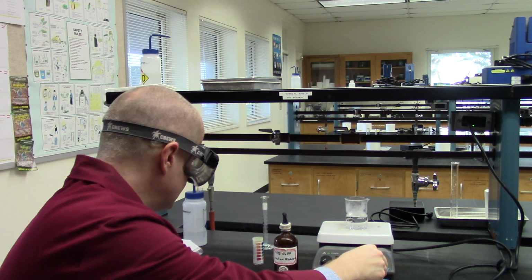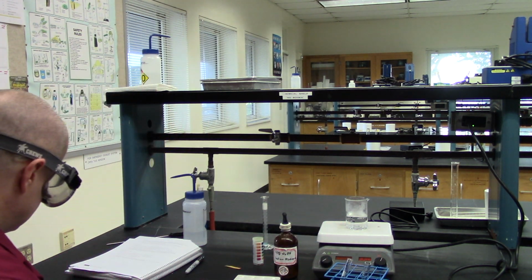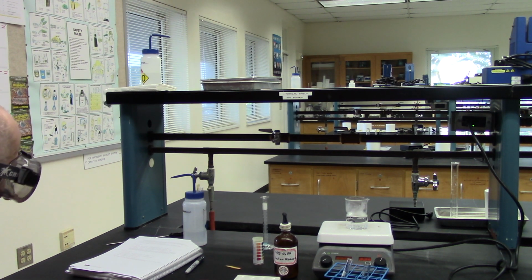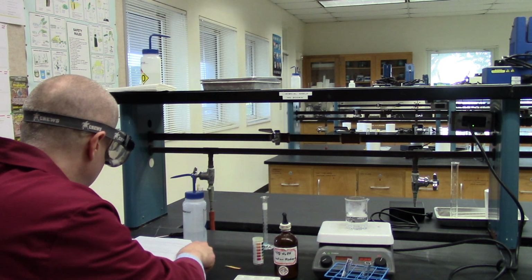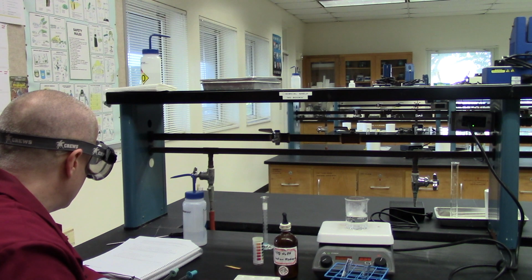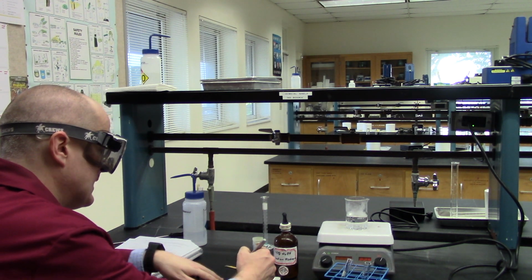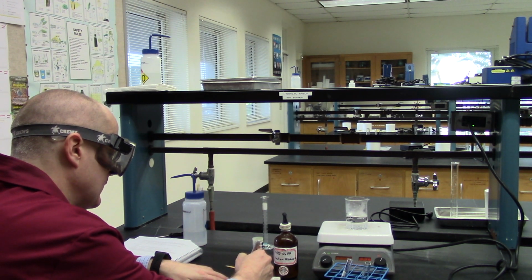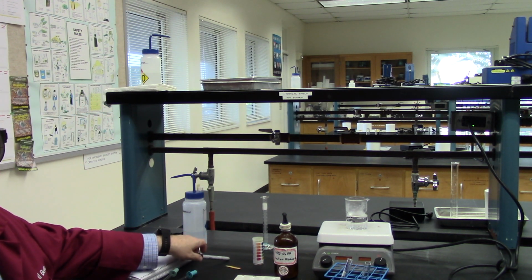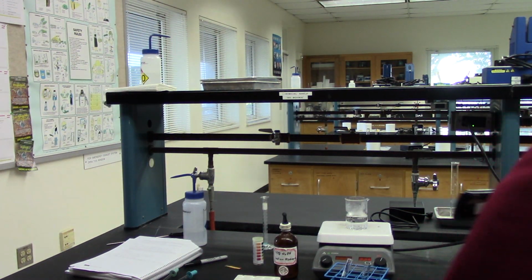Now, at this point, we want to get a sample of each one. So now I'm going to take a spot plate. I'm doing the iodine starch test on page 114. I'm going to take some of the one labeled acid. So let's put an A over here, and then we'll put a W here for the acid and base. Let me get my other camera adjusted here, guys, and I'll show you what I'm doing.